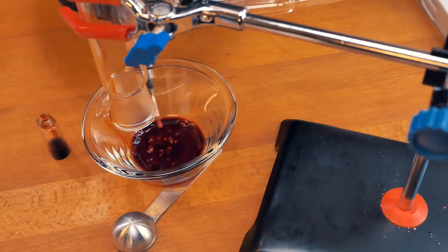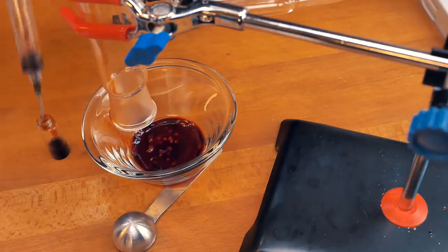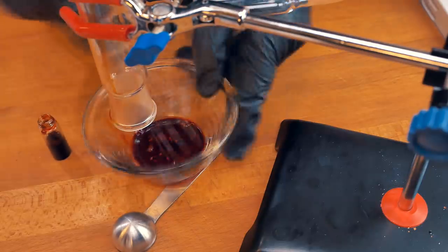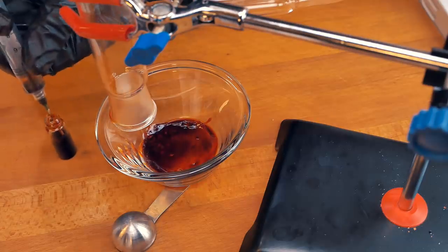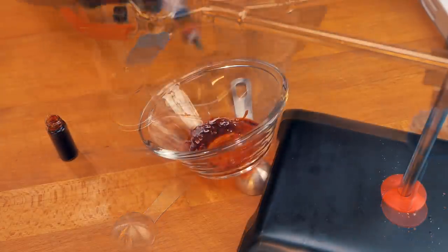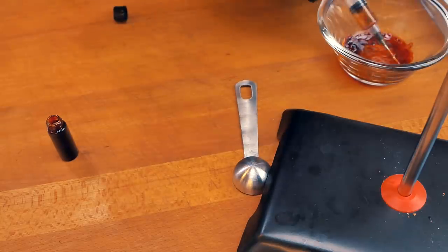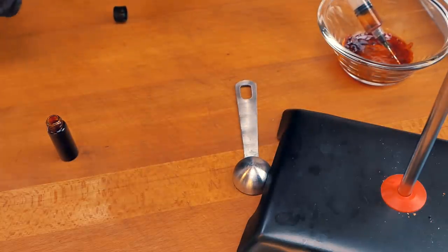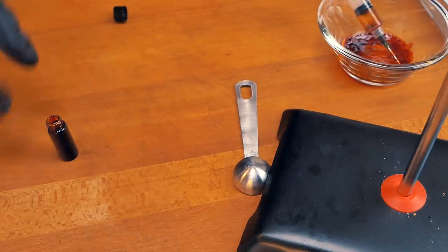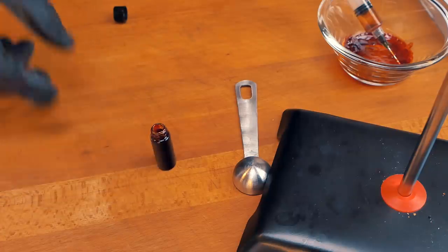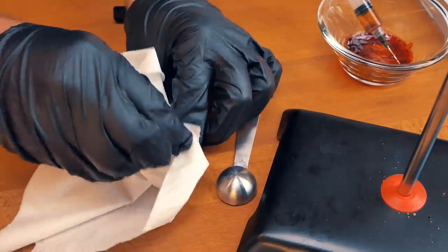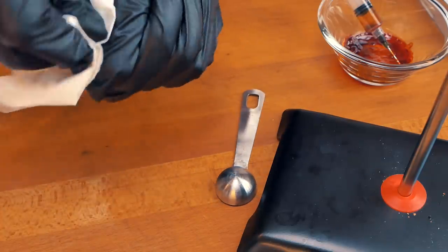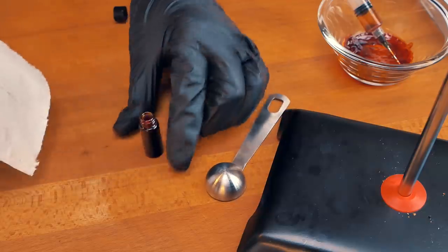My face is stinging like crazy. I think that will do the job for now. And let me try and clean the edge here because I really do not want to be touching this stuff by mistake. I'm going to give this a good wash as well once I get the lid on.